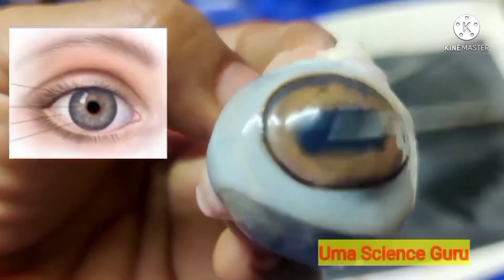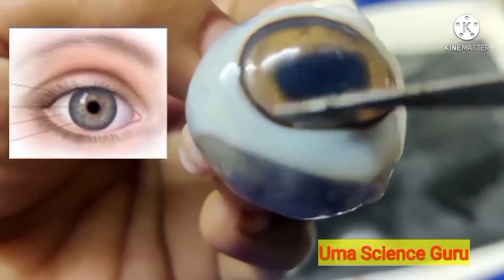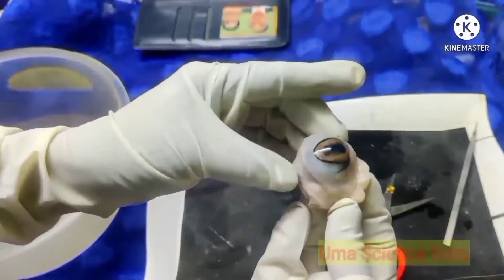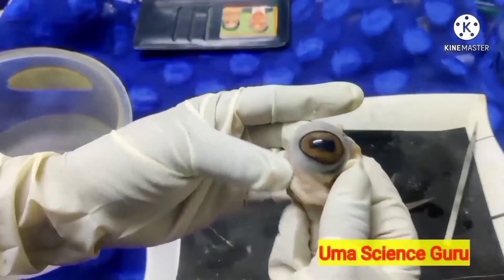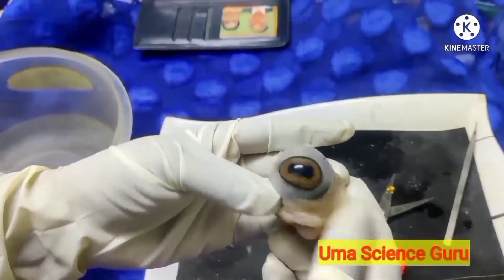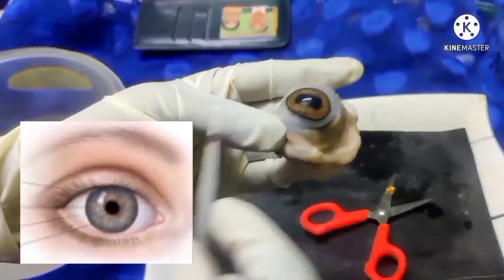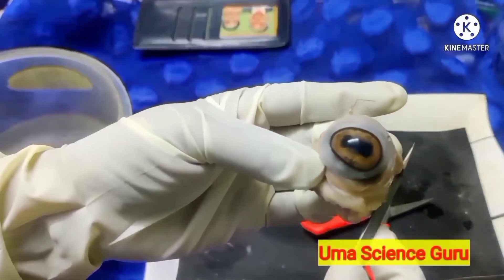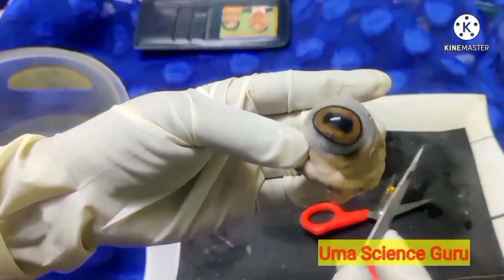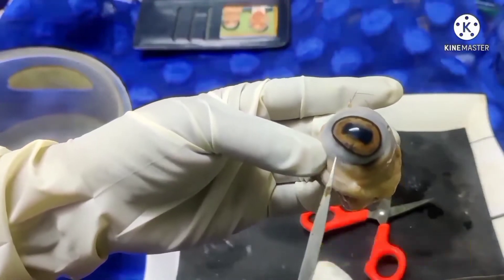In the front portion of the eye, the sclerotic layer forms the cornea, the protective layer. The eye is almost a spherical organ having three layers one below the other. The outermost layer is the sclerotic layer or sclera. The second or middle layer is the choroid layer. The innermost layer is called the retina, which is the sensory region of the eye.